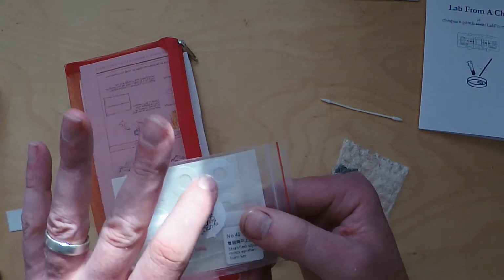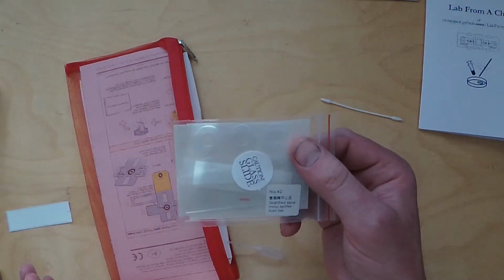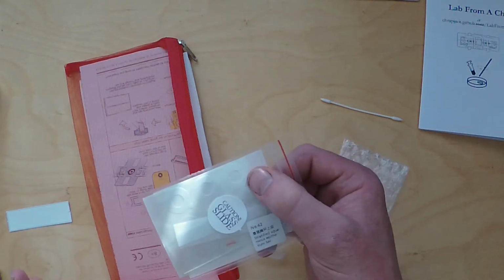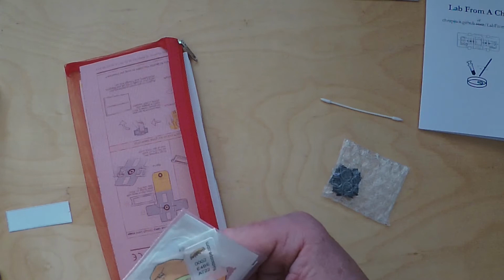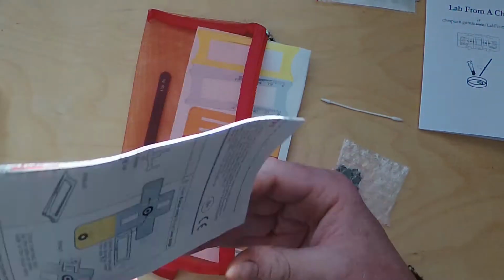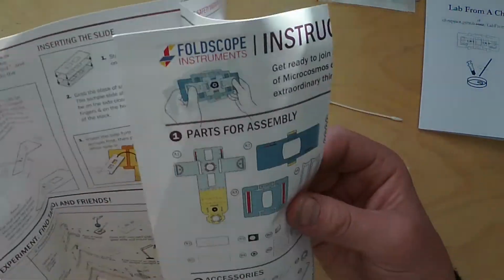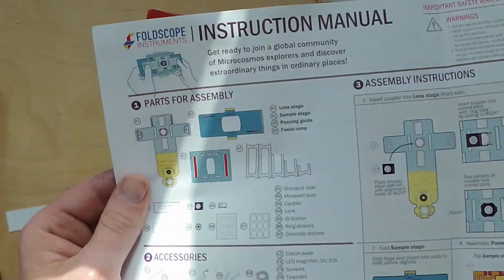You'll also see some stickers here. These are important for attaching the microscope to your phone, so you can capture images on your phone and share them with the group. And there's also sticker cover slips for slide preparation. Again, going back to those later on. So the main thing is the instruction booklet. This is a fold out double-sided set of instructions. You want to start the assembly instructions on this side, and we'll work our way through them together now in this video.